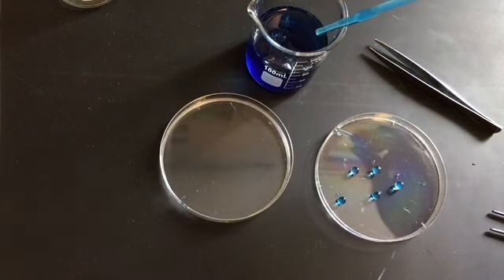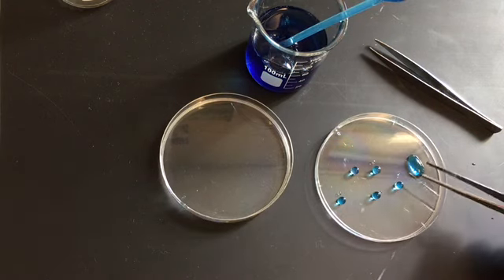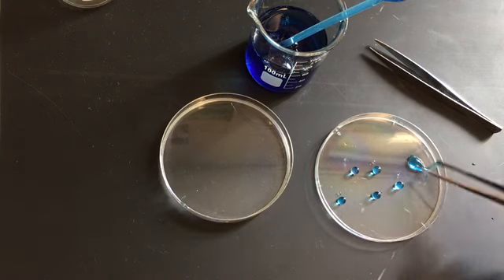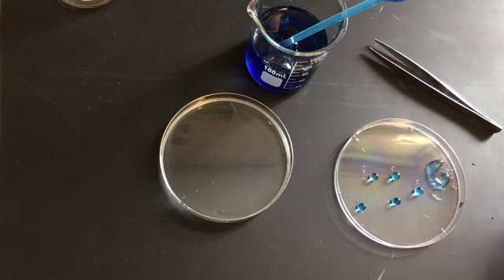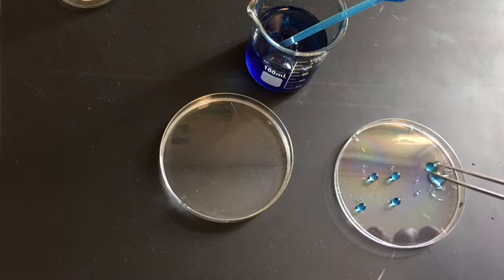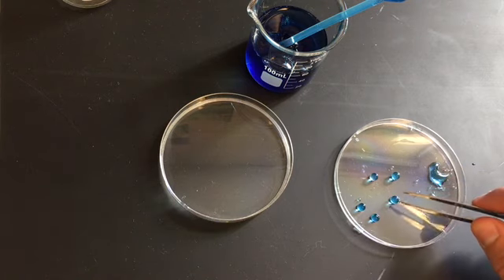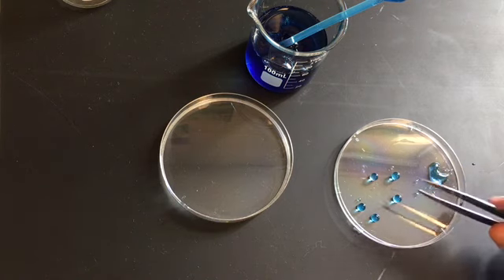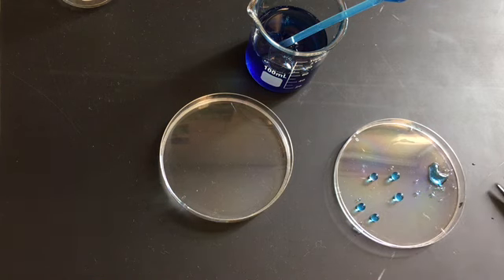So this is a little different than what it looked like by itself. This is what it looked like by itself. This is just the sodium alginate solution. I can't pick it up or do anything with it, okay? It's just gooey and liquidy. You can rub it around or whatever. It is not anything like what our beads are. It's not quite what I would describe as a solid, but it's definitely like a gel or a medicine capsule or something like that. It's almost that kind of consistency.